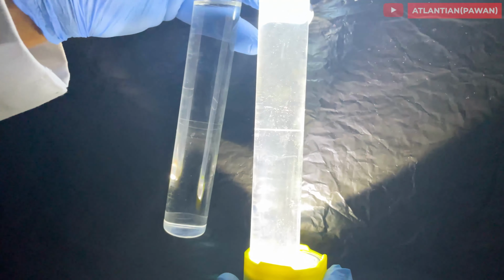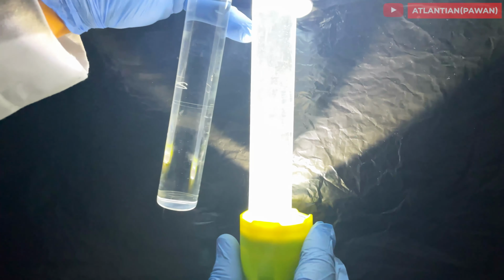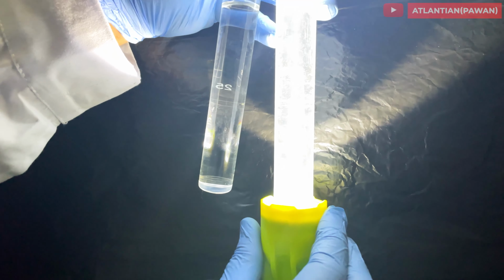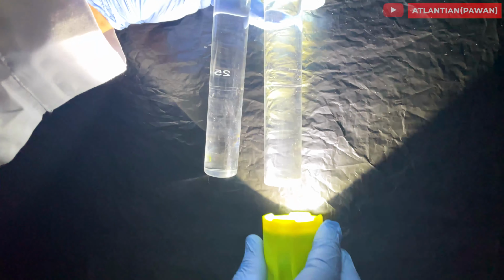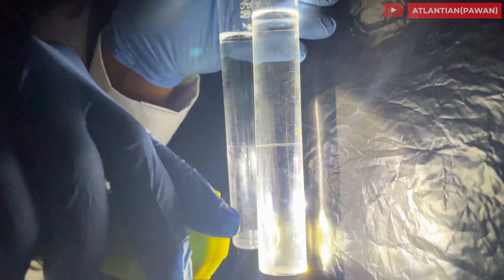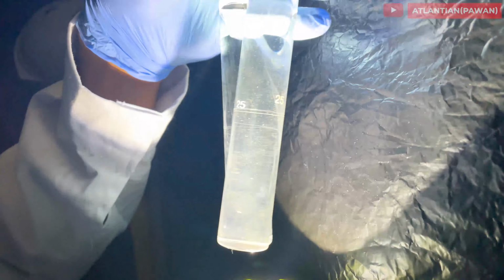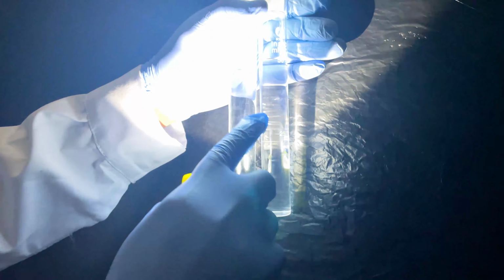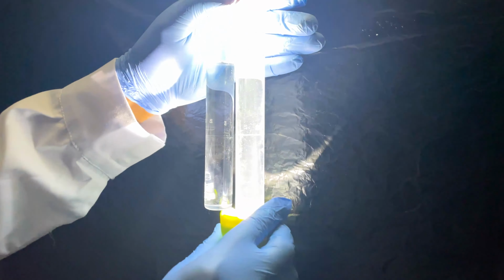Here you can see it is a little bit whitish in nature, and it has a slight milkiness. And by pointing the beam like this, I can also compare whether the beam is passing clearly or not. So this chloride is less than 1 ppm, so that means my tank has almost passed. I don't have to do any more washing on this.